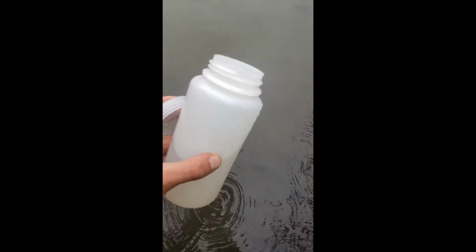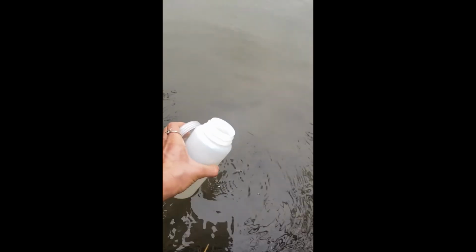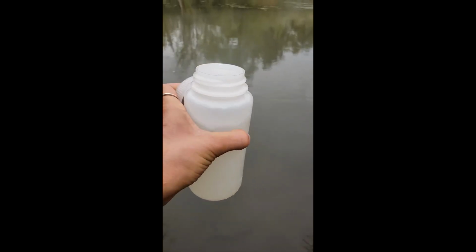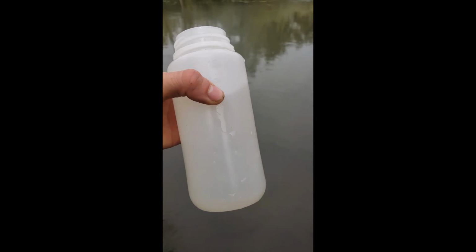Okay, so make sure different safety things. Make sure you're not going to fall in, that you're stable on the surface, and try not to disturb any of the other factors, the sides of the banks. Don't cause erosion to start happening there. Okay, so I got my sample of water.